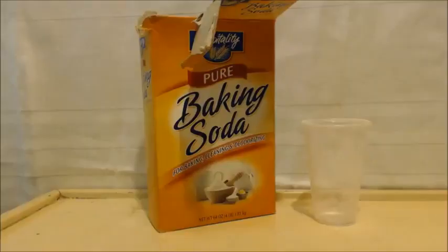Wow, I am actually impressed. I cannot believe this. I put it all in. I still got a pH of 8, and still reacting very, very slowly. So I threw in another gram, and it reacted with that. But after that, that was it. So there might have been some in solution that didn't react. I might have added a little bit more alcohol than I thought, a couple milliliters of water. I mean, ethanol. But this is pretty much a 100% conversion, man.